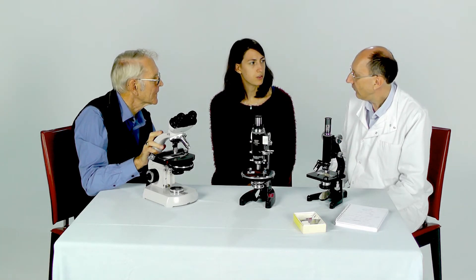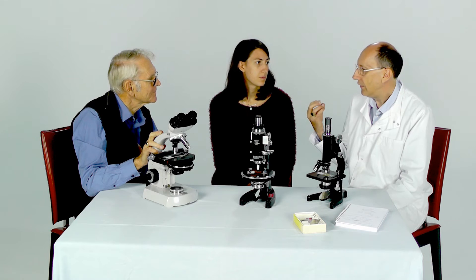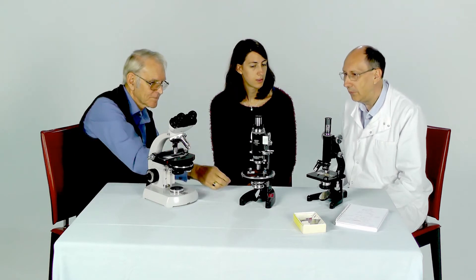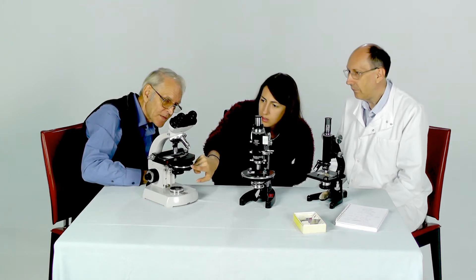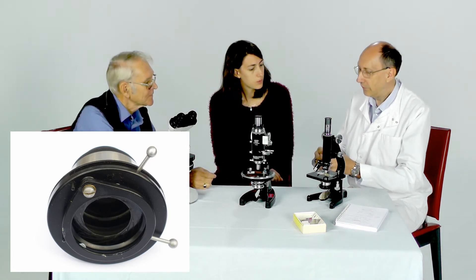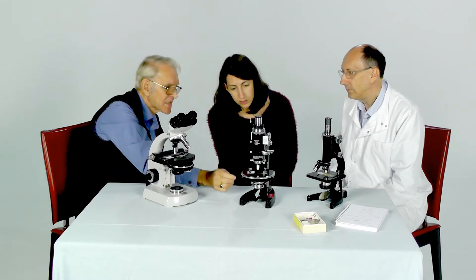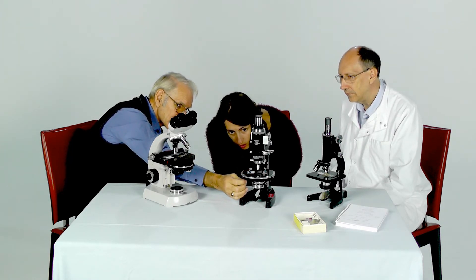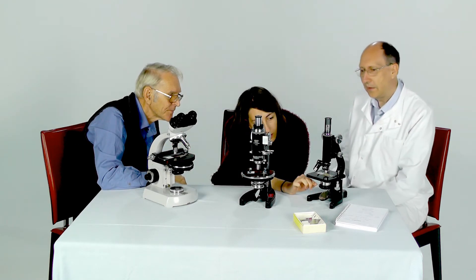Is it called the iris aperture because of your eye? It's because it works like your eye. An iris diaphragm, which is what these have, is something that can expand or contract. Do you remember how you did that, Louise? I did it with this little bit here — that moves round. That's right. So that opens a circular aperture or closes it, very much like the iris in your eye. You have exactly the same sort of thing on the other microscopes here and here, but the adjustment is made with a little lever.